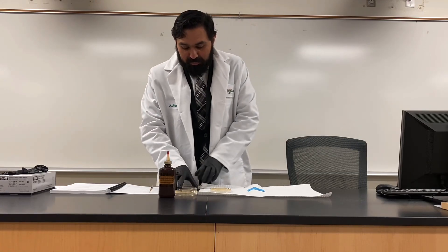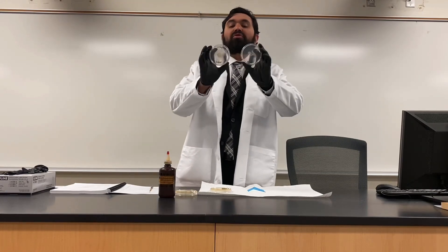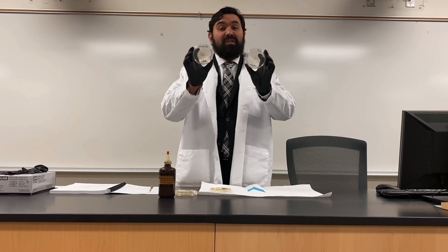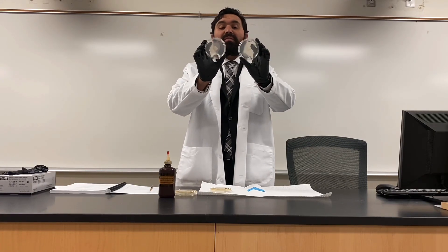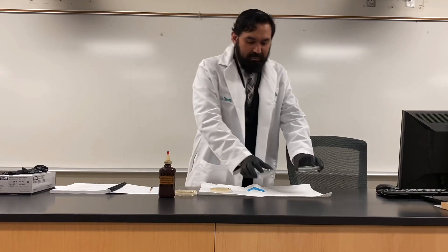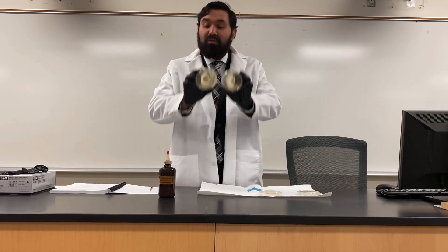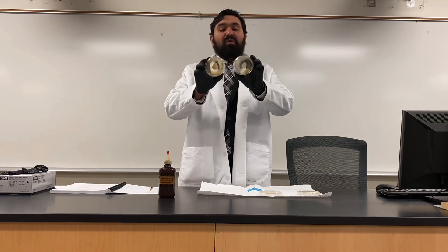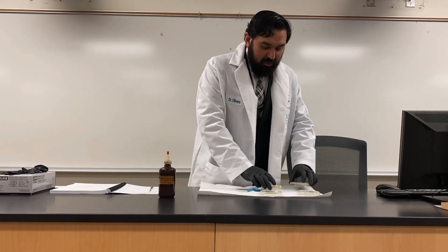Here we have two plates that contain starch — the amylose or starch plates — which have already been inoculated with E. coli and Bacillus megaterium. We also have our milk plates, which look a little cloudy as mentioned, and those have also been inoculated with Bacillus megaterium and E. coli.